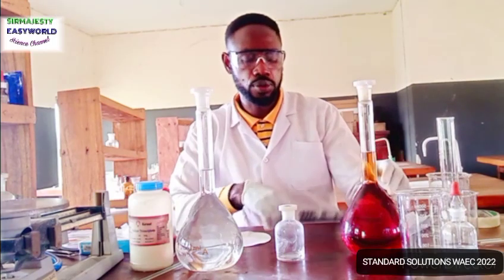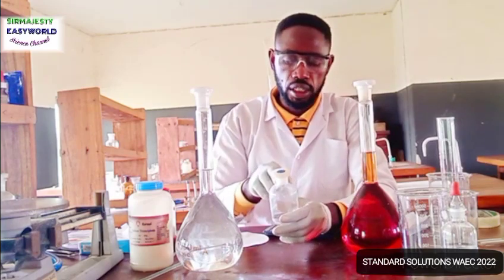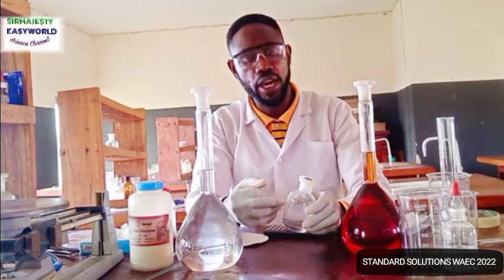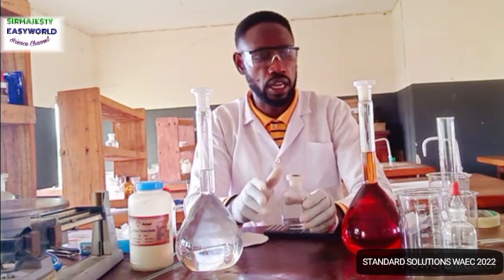So when you prepare 8 times, you now use this little 150 ml and add it for each student and label it AN, as they told you, where N is the registration number, the examination number of your student. This is the way to organize it.